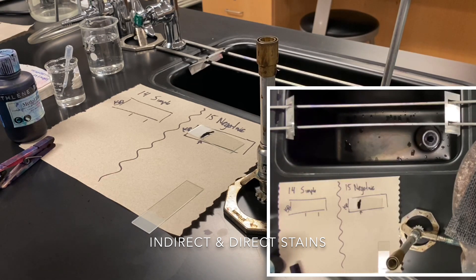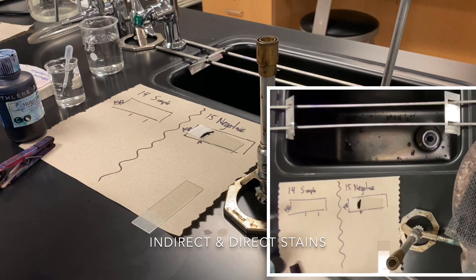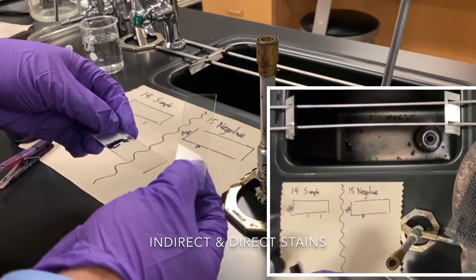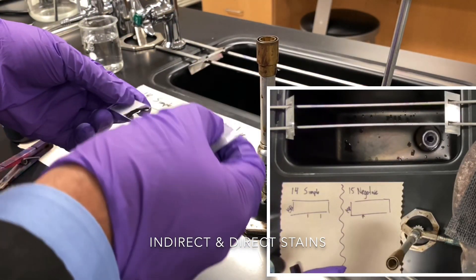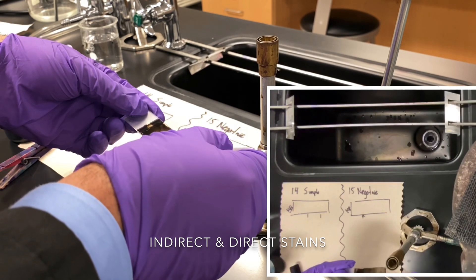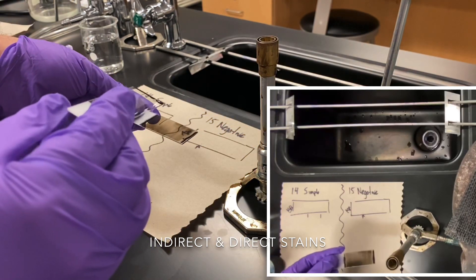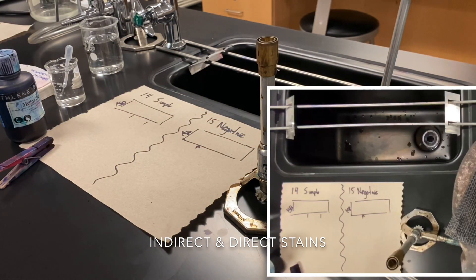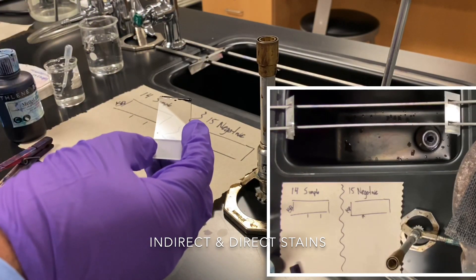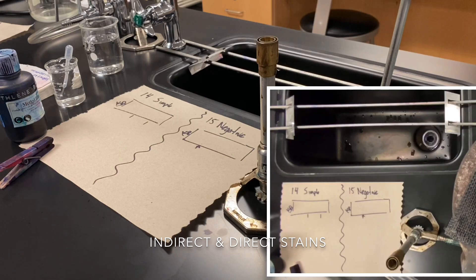Instead of using the loop to mix the India ink, we'll use the technique the procedure calls for: an extra slide already prepared. Take the extra slide and spread or thin out the ink, mixing it in and extending it all the way across, essentially thinning it out. That is what needs to air dry, so I'll place it on top of the air dryer. The other slide needs to be disinfected since it has organisms, using the disinfectant solution up front. We'll pause and continue in the next step.